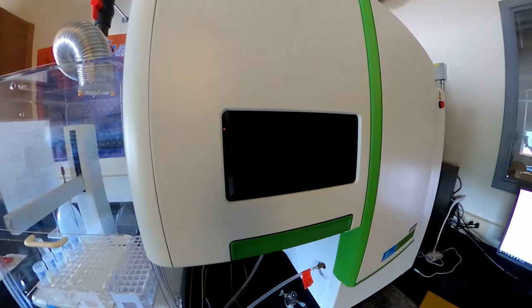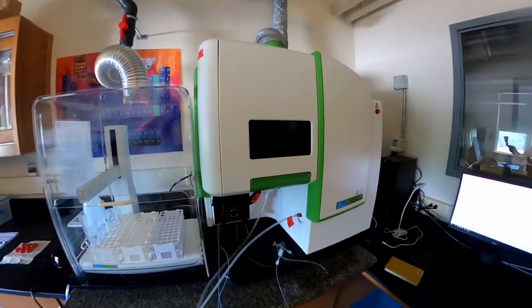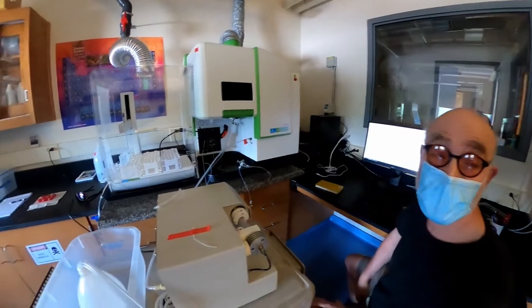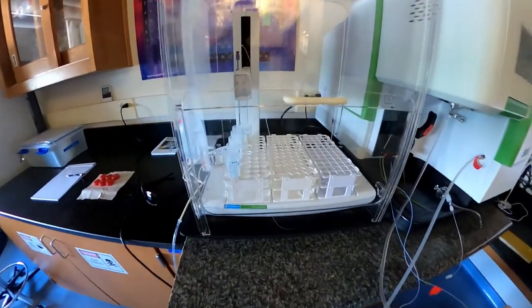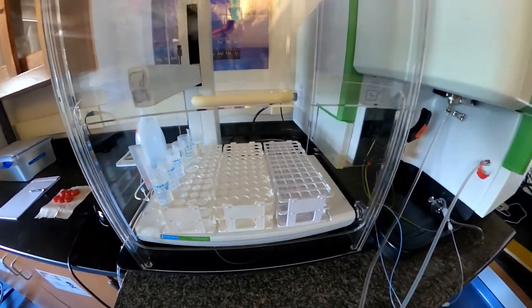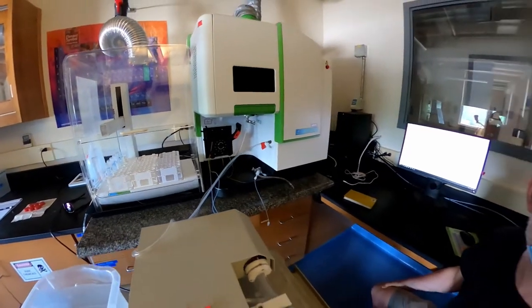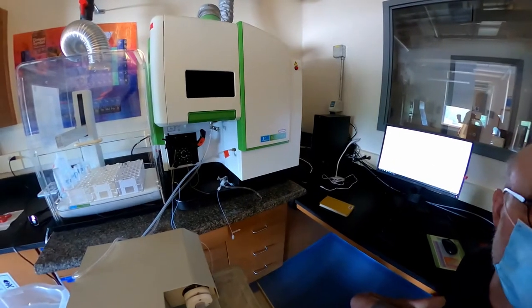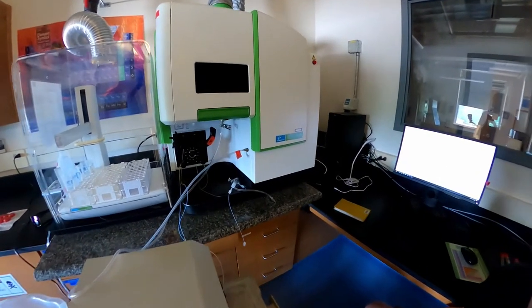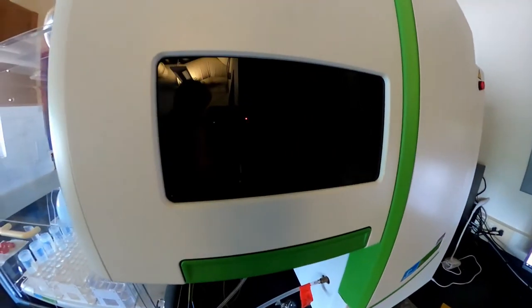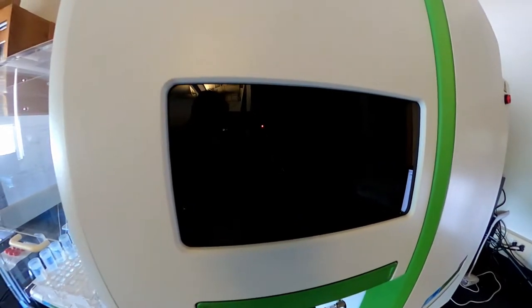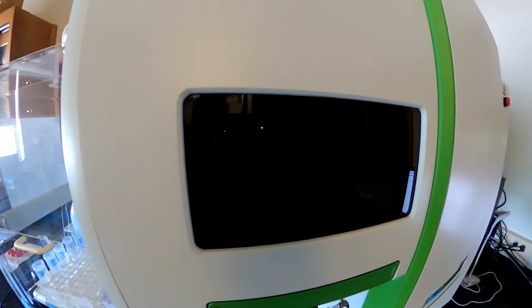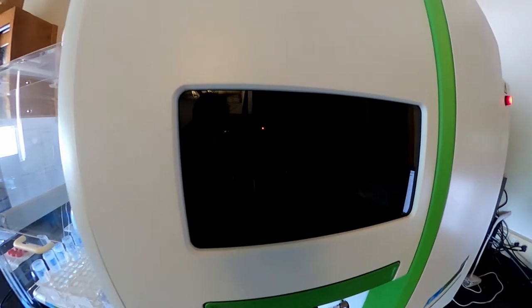We have 26 seconds left to go here on the software. This is a pretty much automated machine. Once we get it running, your samples will be lined up on those racks, and they'll take about three or four minutes each. And we'll get an analysis of how much lead copper and chromium are in the samples that you sent. Today we're running a couple samples from Nico's house. We expect those to be clean, because Burlington water system is really clean for lead, typically.